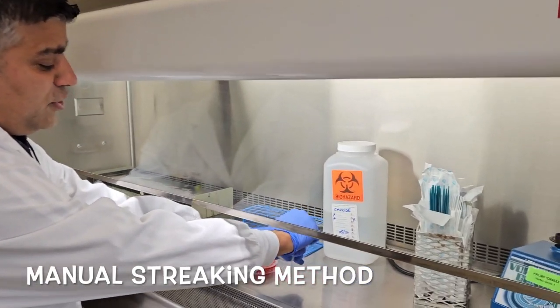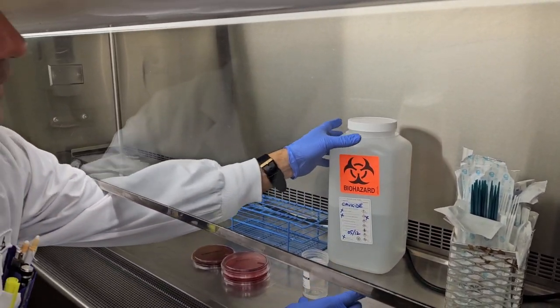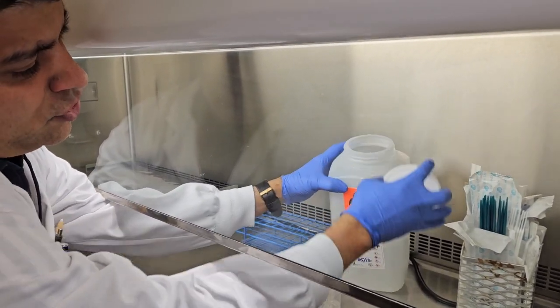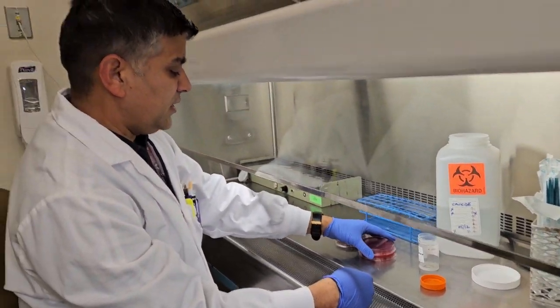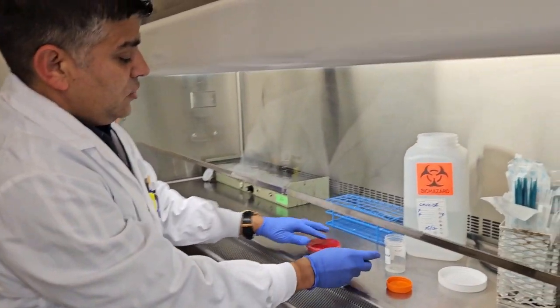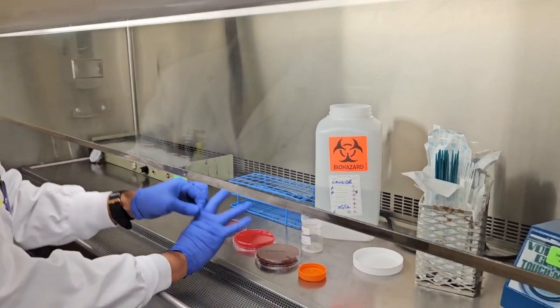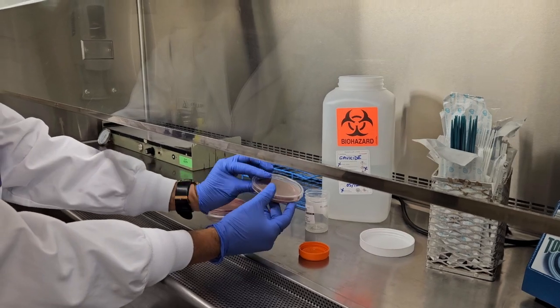So this is the sputum sample we received today in the lab. Since these are clinical specimens, they might have so many nasty things. We need to process them inside the biological safety cabinet as a safety precaution. That's what I'm going to do now. So you can see I do have three culture media. That's what we usually do for sputum samples. One is chocolate agar, looks like chocolate to us.